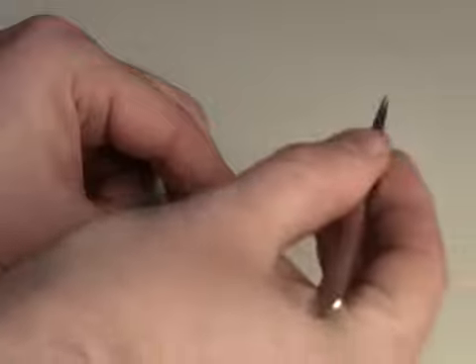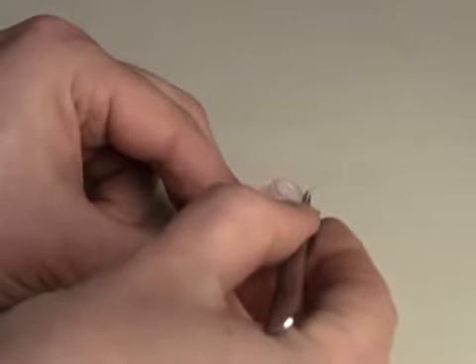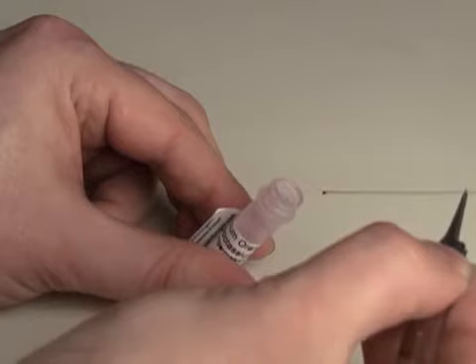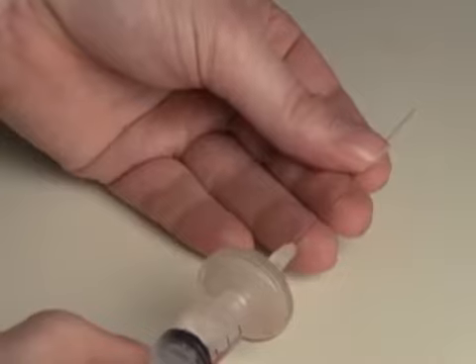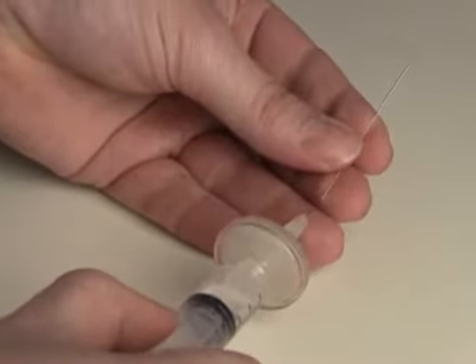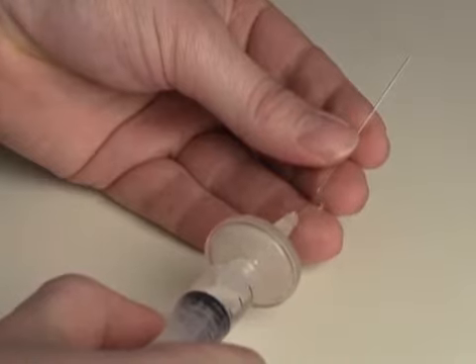To fill the dye electrodes, dip the back of the pulled electrode into a 10 millimolar solution of the calcium orange dye. Capillary action along the glass filament inside the electrode will draw dye into the tip. Then backfill the electrode with 200 millimolar potassium chloride to ensure good electrical contact.